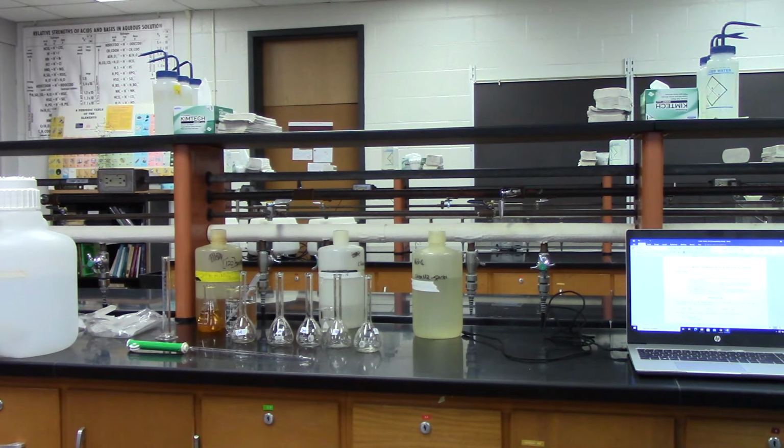So number one, we're going to learn how an equilibrium constant can be measured experimentally, and perform equilibrium calculations involving changes in concentration as the system reaches equilibrium. So this is like an ICE table. You're going to see how I use the spectrophotometer again, like in the intro spec lab. And basically you can see me do some more dilutions like I did with the intro spec. So I'll send you out the lab that has to do with this.